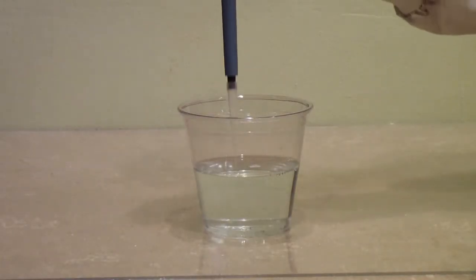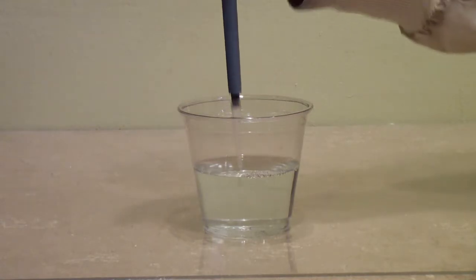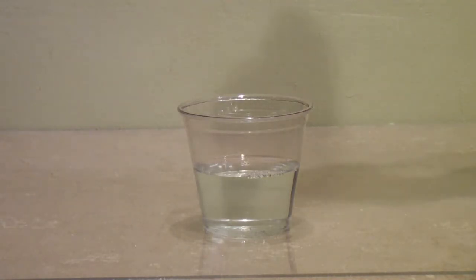If you were to put the tip in the liquid first and then press down on the plunger, you would blow air bubbles in the liquid. Depending on the type of liquid that you're trying to pipette, this would make sucking up the liquid inaccurate.